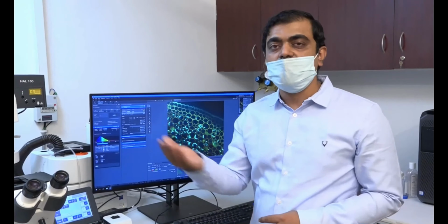There is always a histogram below. This histogram will tell you the signal intensity. As you can see, if I right click here, it is being taken at 16-bit. This 16-bit distribution you can change also, but depending on the signal to noise ratio, this will automatically come. Most of the time it is either 16-bit or you can keep it at auto.